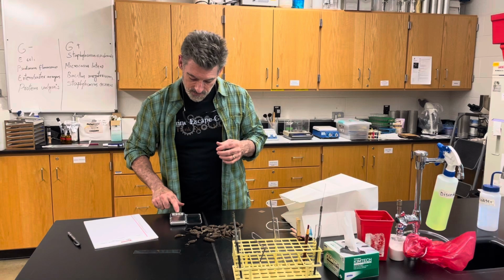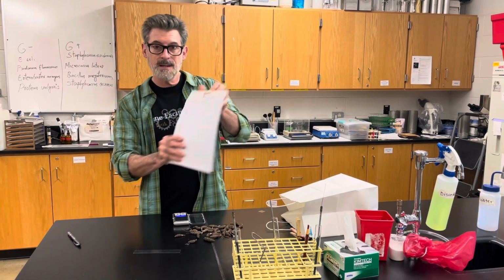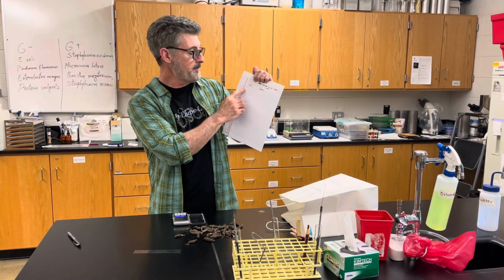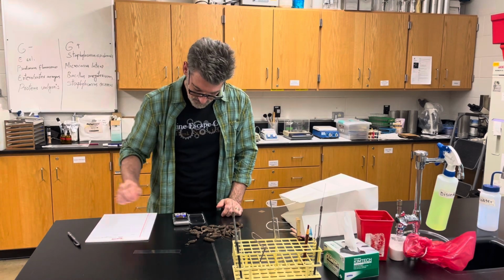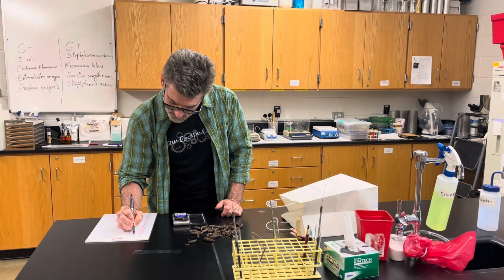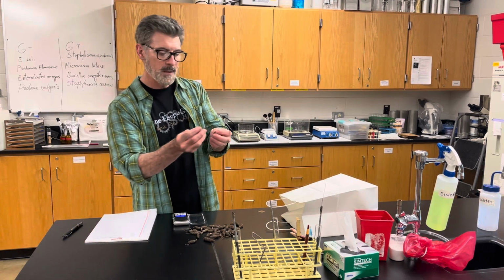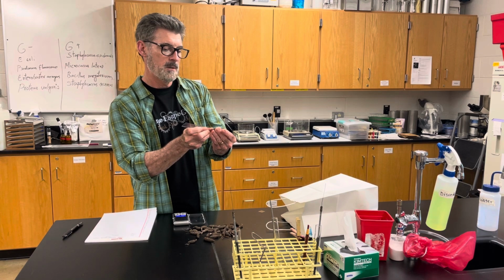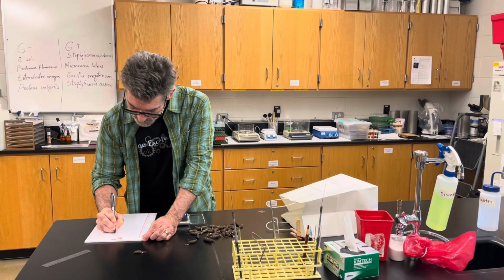So what you'll be doing is turn on your balance, make sure it's tared, and get a data sheet. It's going to be, say, for 100 data points. Write down the organism, weight, length. So I'm going to take just one cone here and put it on the balance. You don't see the weight here, but I'm going to write it down: 1.08, and the weight is in grams, okay? Now for this exact same cone, in millimeters, I'm going to measure its length. Okay, so it's 24. So my length is in millimeters, 24.